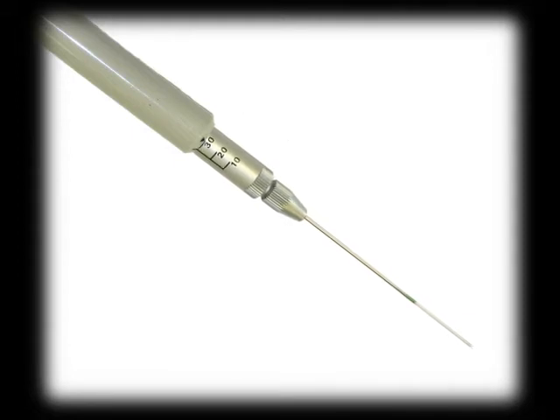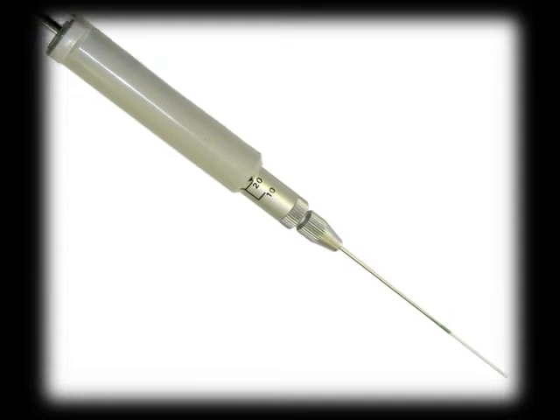To select the volume, slide the barrel till the selector position is aligned with the volume and lock it into position. The plunger moves up and down by pressing and releasing the plunger rod.